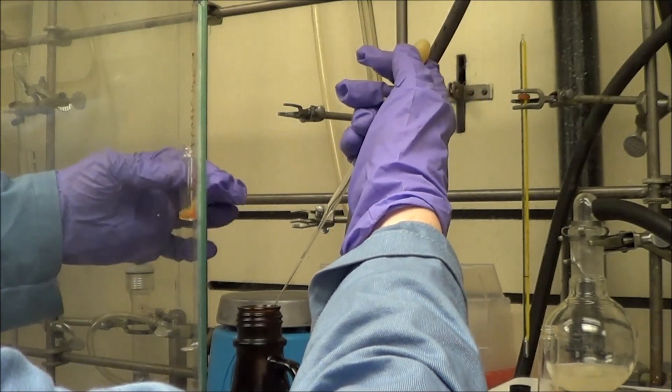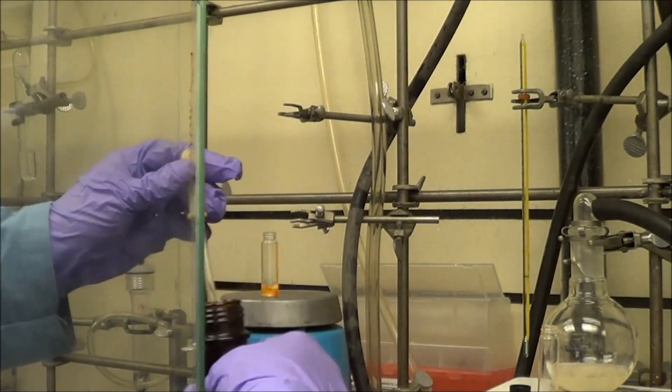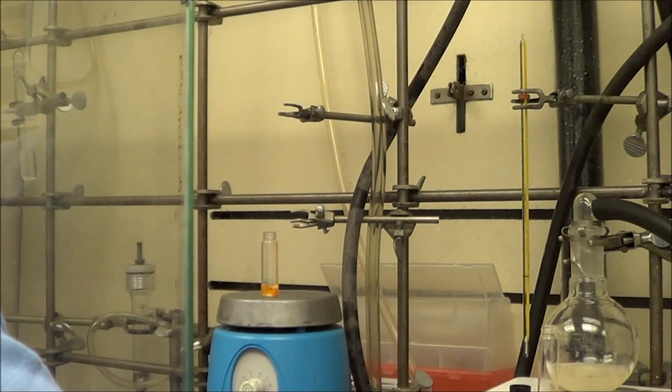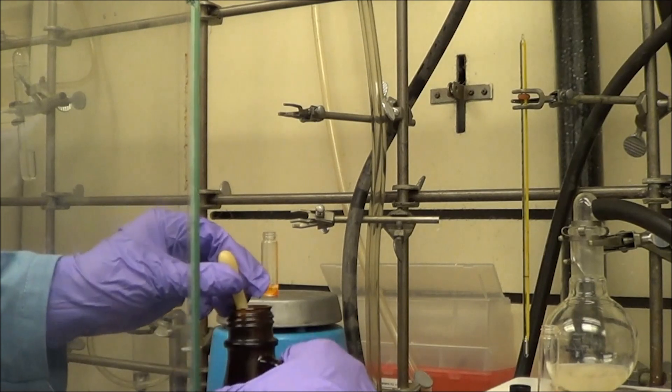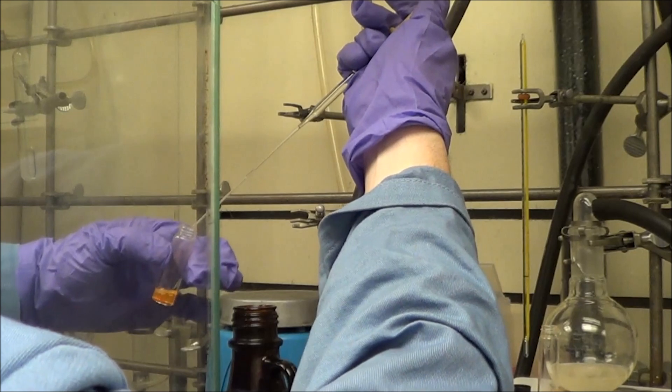Once the polymer is added, now you see me adding chloroform, and this part's crucial. You need to see the dots dissolve well into the chloroform. If the dots don't dissolve into the chloroform, if they seem like they're still precipitated, this isn't going to work.